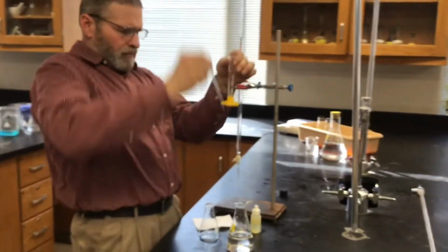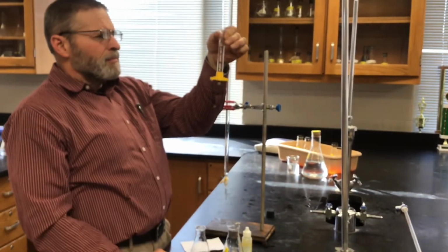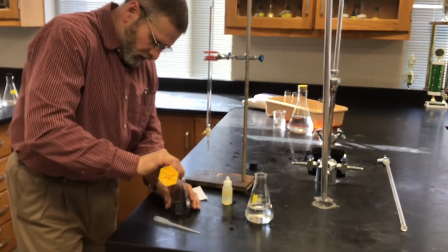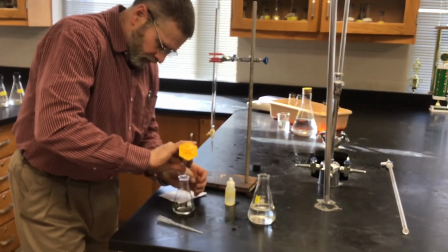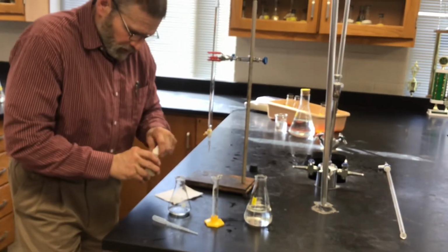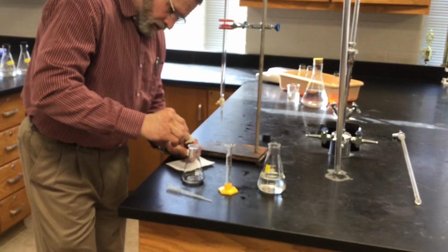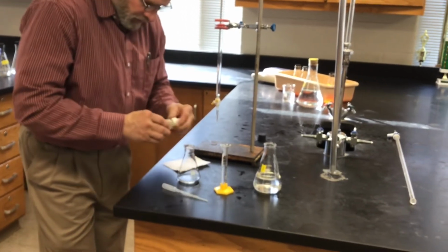Okay, 0.0 milliliters, 6 drops. 1, 2, 3, 4, 5, 6.